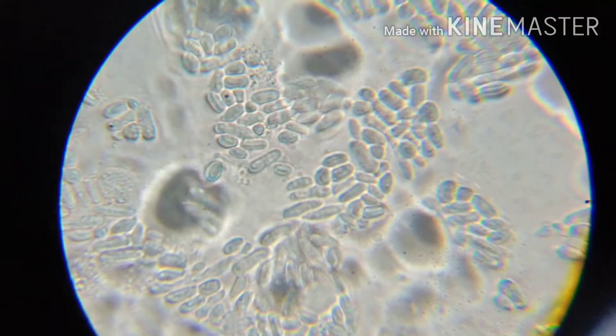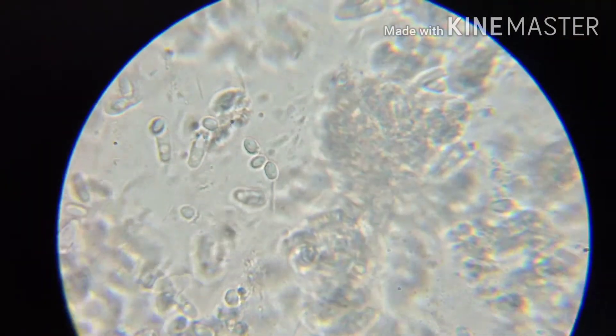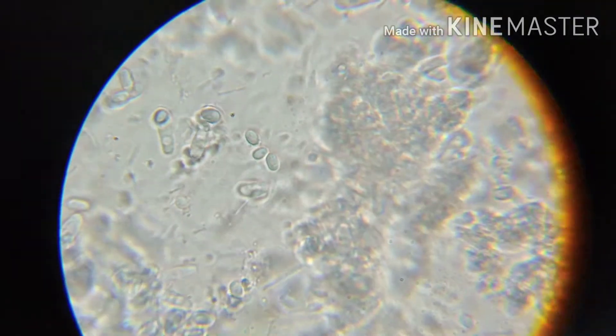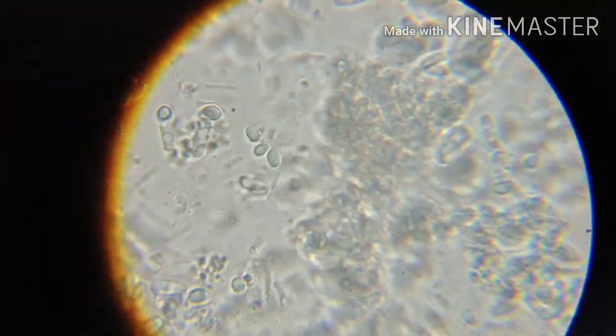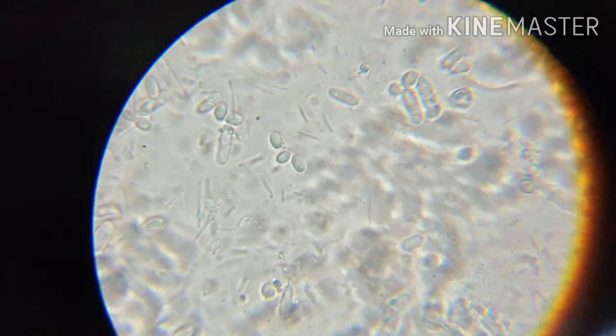Sorry for the blue screens — that's because of the shading of the camera. The stick-like structures — the bacteria — are noticeably more in the sour curd compared to the fresh curd I took before. Look at that — the stick-like structures are pretty much more than the ones in the fresh curd.